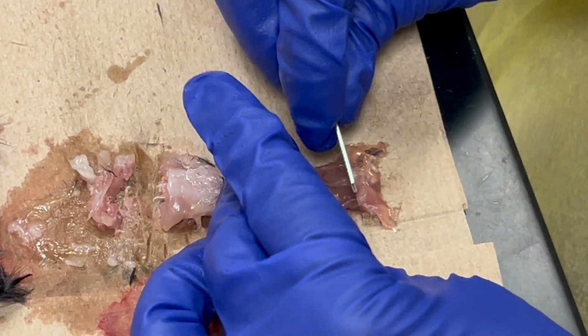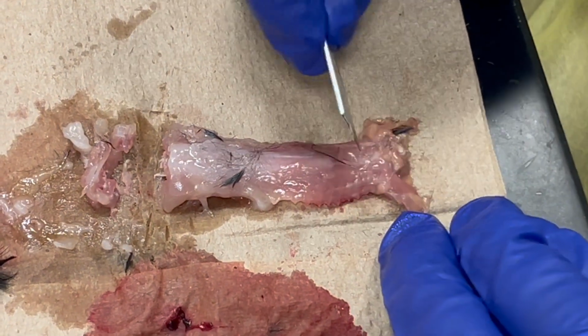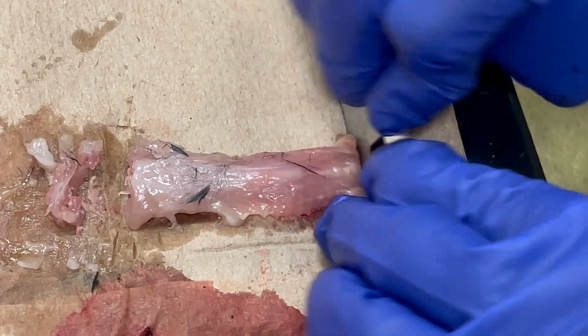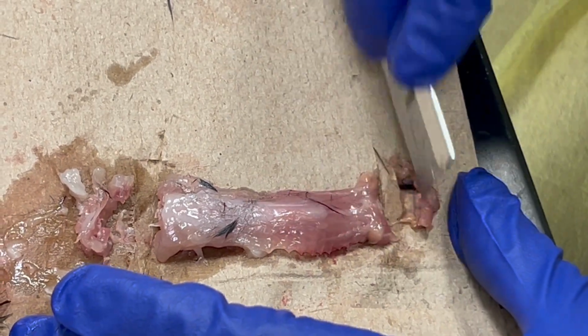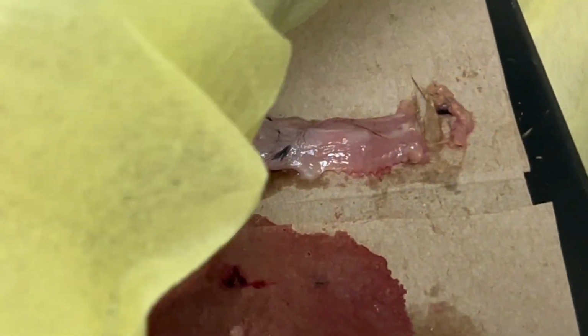I am usually not interested in the thoracic or cervical spinal cord at all. That's why I'd rather try to keep it a little bit plain. If it's a clean cut, it helps quite a bit to flush that spinal cord. That's kind of why.